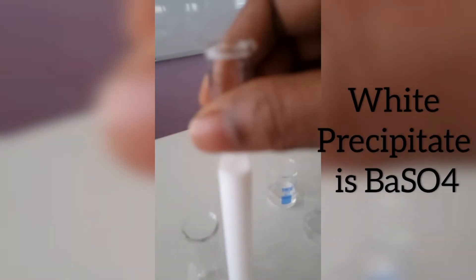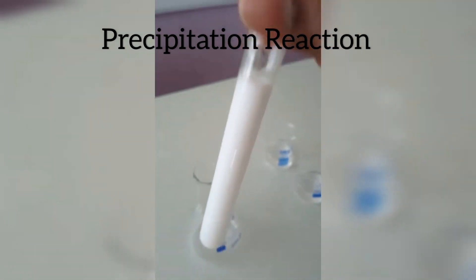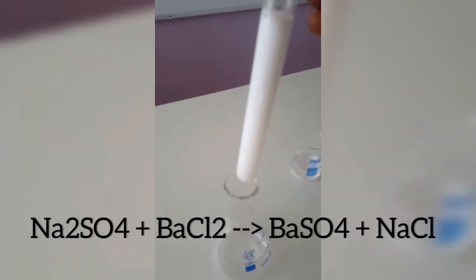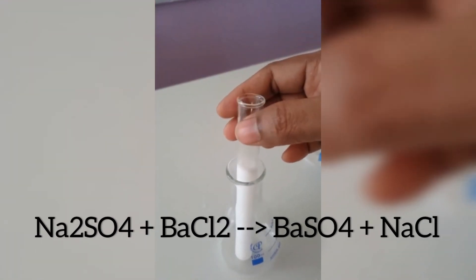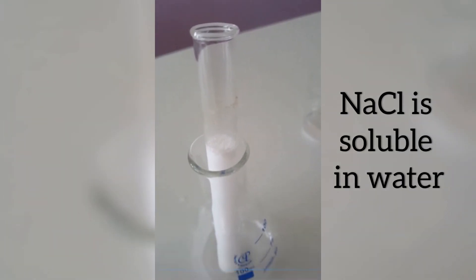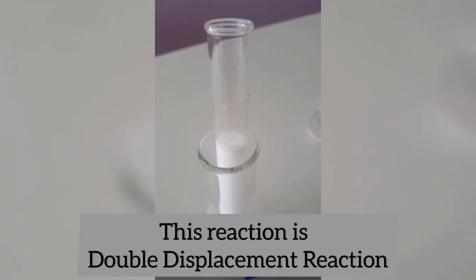This reaction is also called a precipitation reaction because a precipitate is formed during this reaction. When you write the reaction, you can see that sodium sulfate reacts with barium chloride and the products are barium sulfate and sodium chloride. Barium sulfate is obtained as a white precipitate and sodium chloride is soluble in water so it will not precipitate. This reaction is a clear example of double displacement reaction.